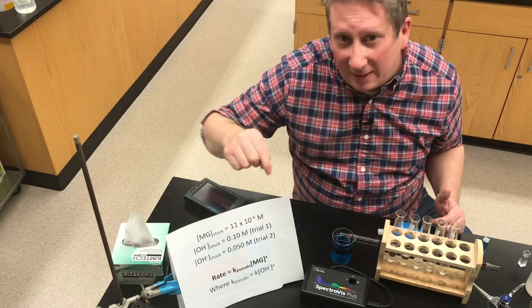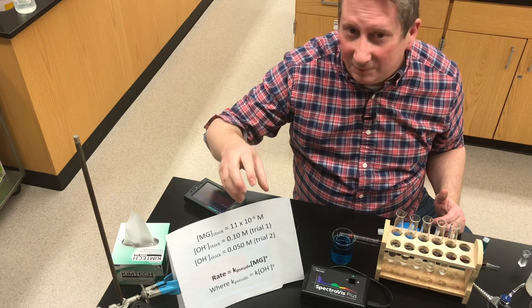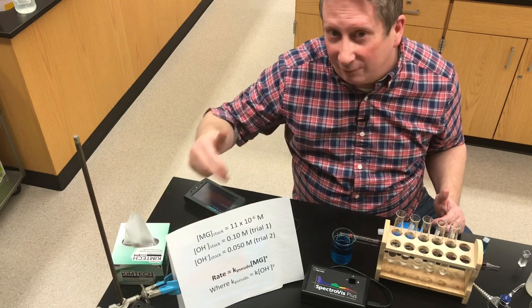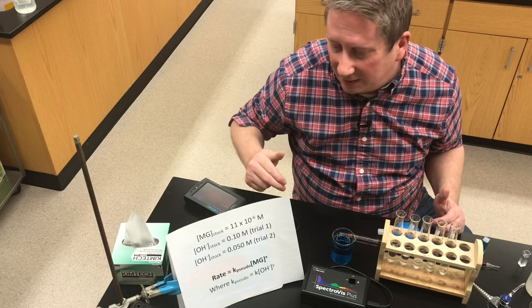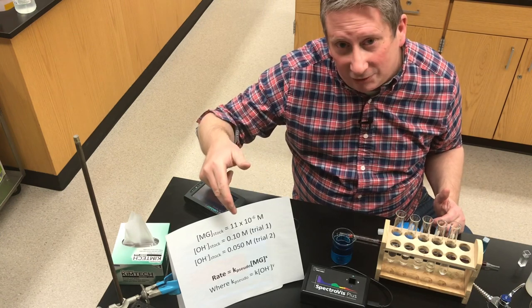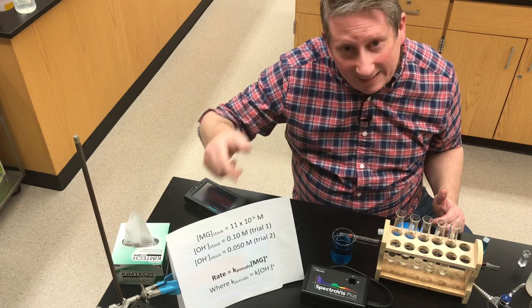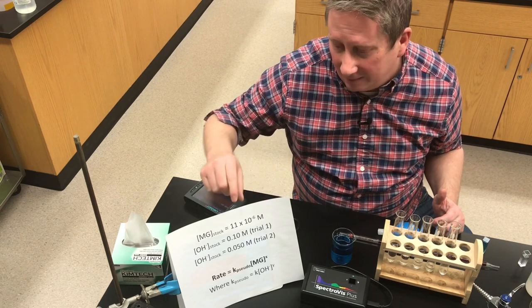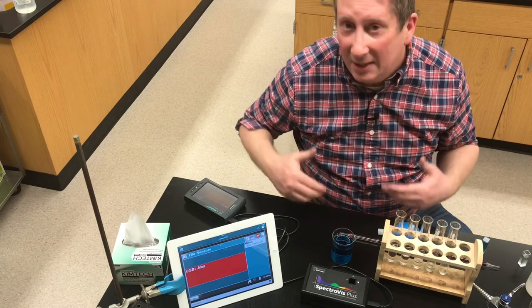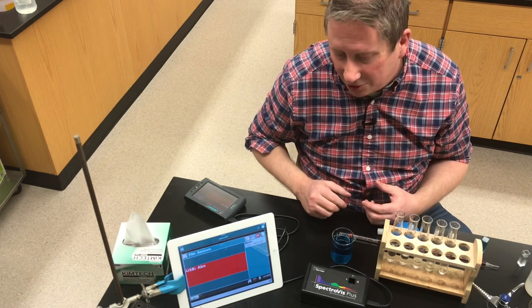Remember that the pseudo rate constant combines two things: k_pseudo equals the original rate constant k times [OH⁻]^y. We'll do two trials with two different hydroxide concentrations, measuring k_pseudo for each. Knowing k_pseudo and both hydroxide concentrations lets you determine hydroxide's order y and the actual rate constant k. The lab's goals are: determine the order for malachite green by integrated rate law, find k_pseudo, determine the order for hydroxide, and find the actual rate constant at room temperature.